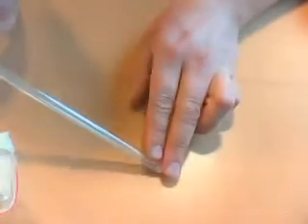For this demonstration I'll just use a bit of sugar. I pour a little sugar into the funnel and let it go to the bottom of the capillary. Then I weigh it, remove the funnel, and weigh it again.